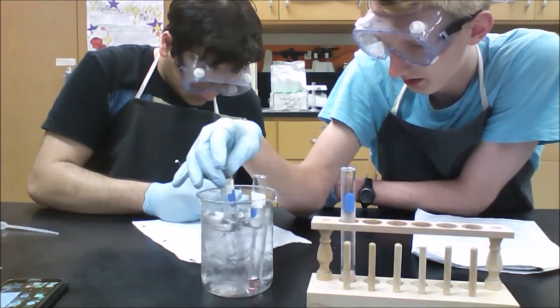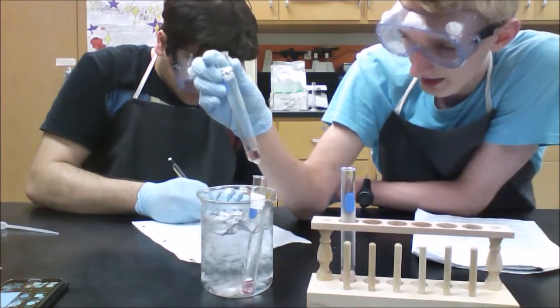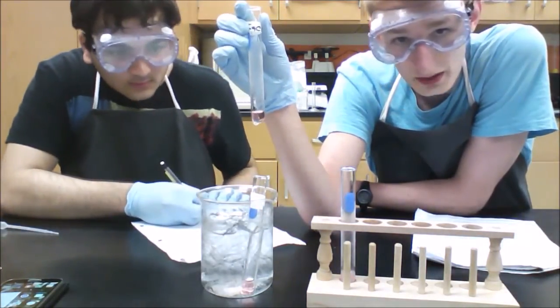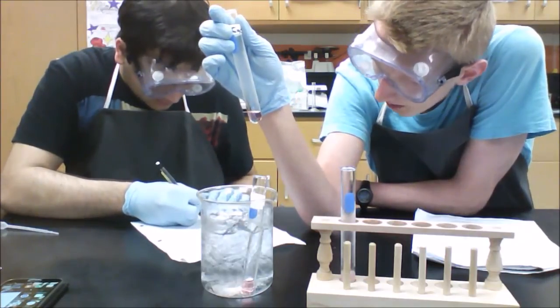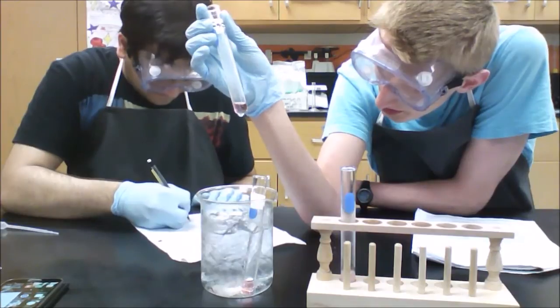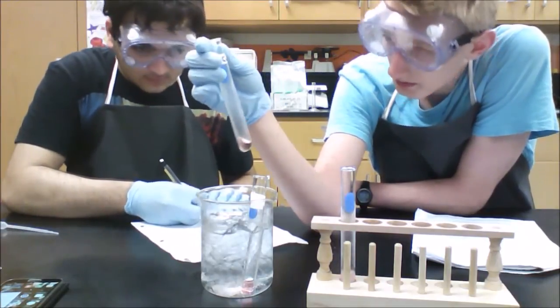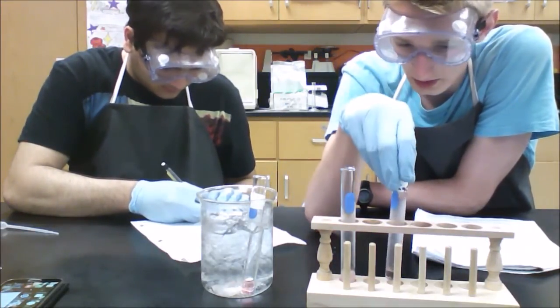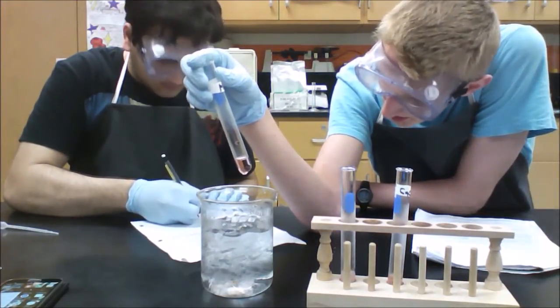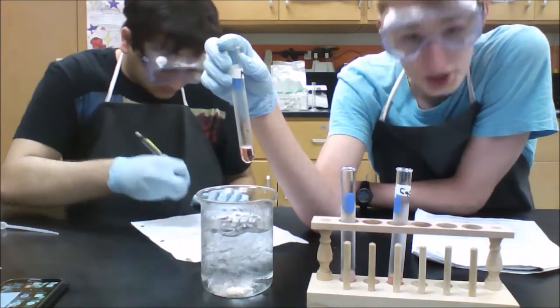We're going to take a look at our CaCl, and this one's very interesting. You can see that there's some blue tinge on the very bottom of it, and the rest of it is a light pink magenta. So we see that there is a little color change on the bottom. Very fascinating. We're going to get our HCl, and our HCl didn't change much. Still a light, clear magenta color.